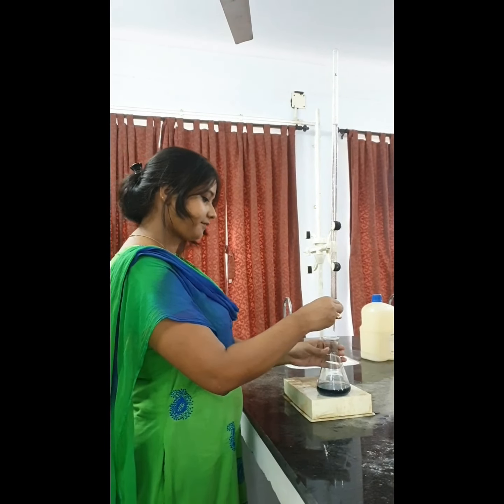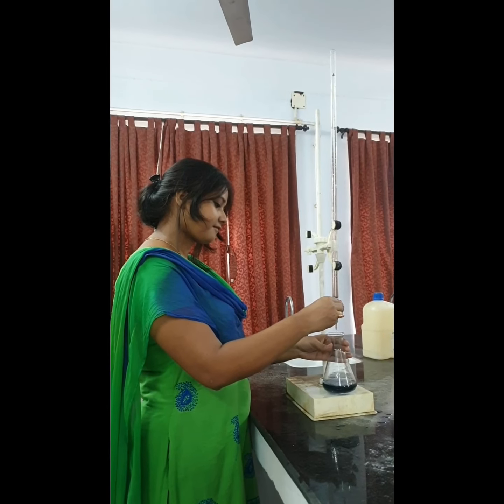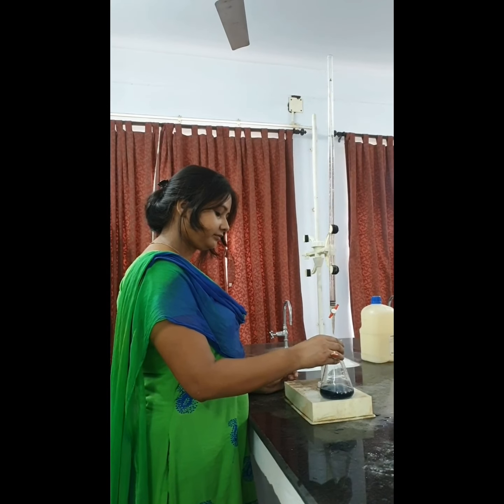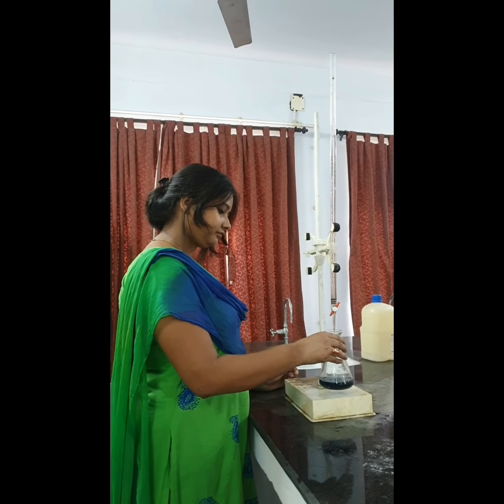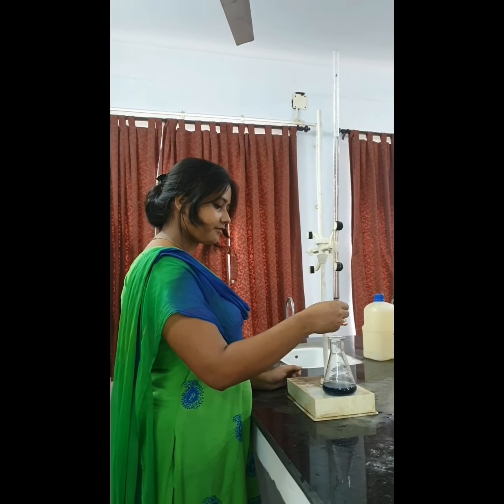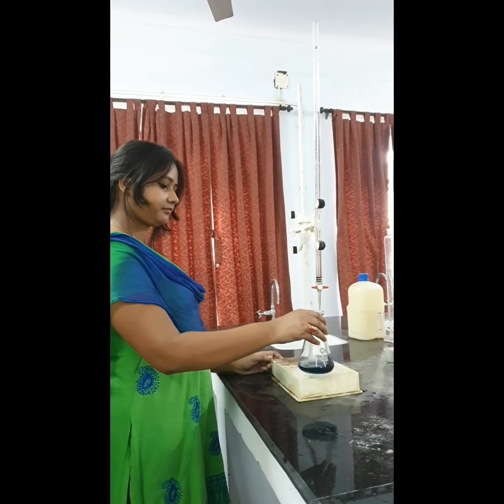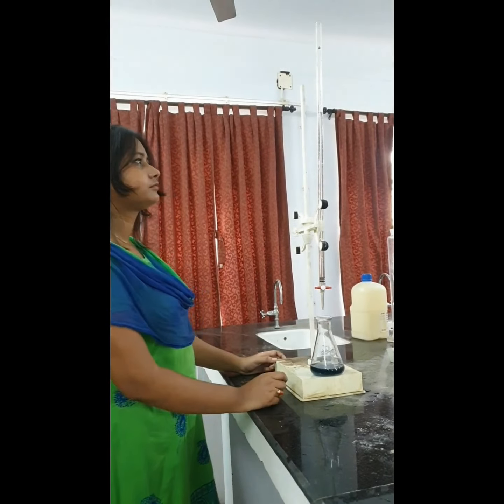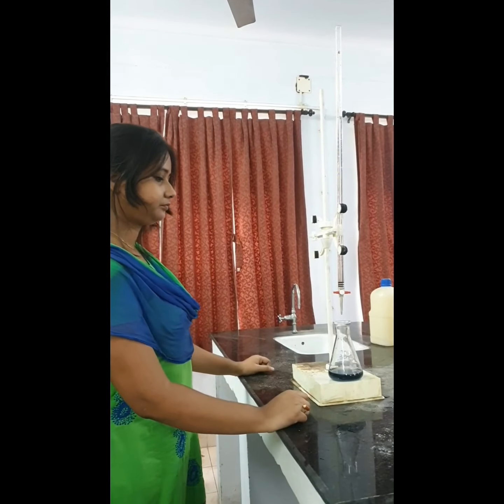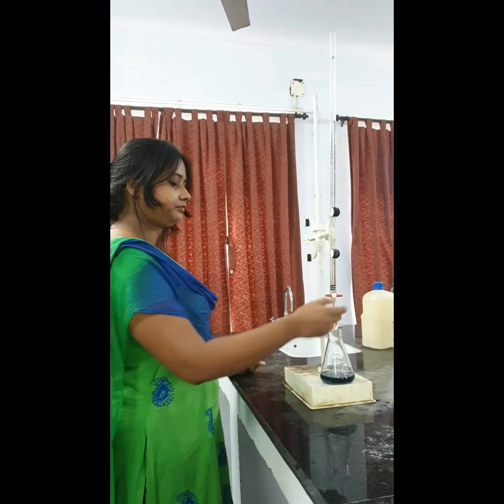Now you see the sample has turned into blue color. The sample water with EBT indicator has turned blue. This is the desired end, wine red to blue. That means our titration has been done for the sample. Stop. Blue color has been achieved. So dear students, we will note down the final volume of the burette. The initial volume was noted down. This is capital A, the amount of titrant used for the titration of the sample. Initial volume was noted down, and after titration the final volume has been noted down.